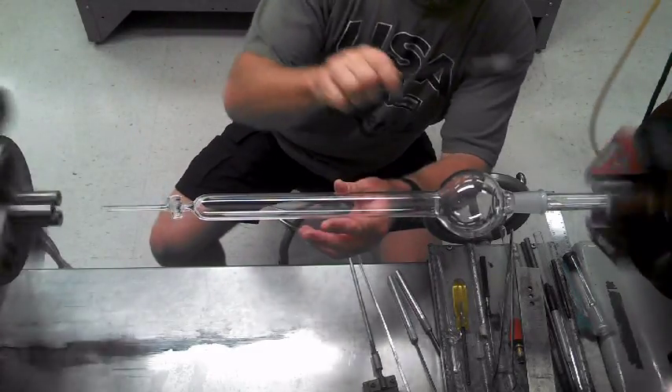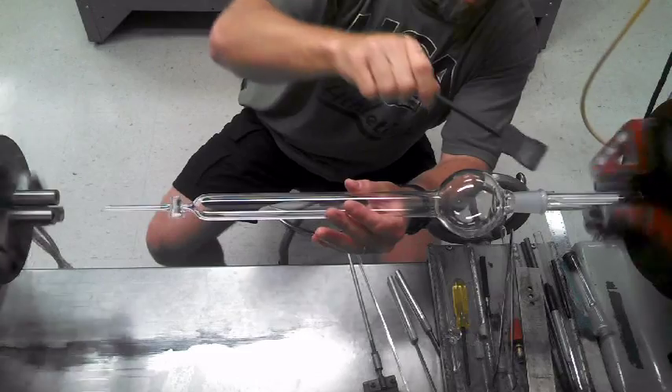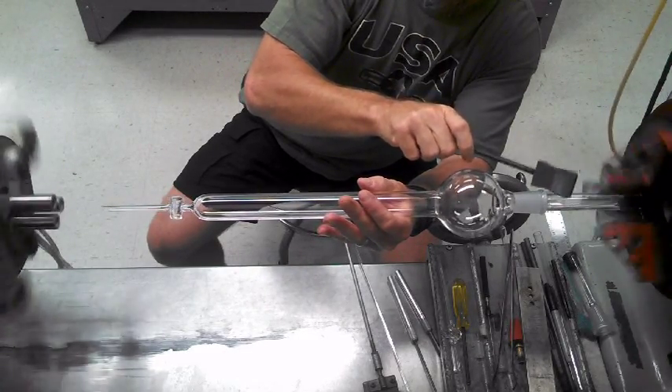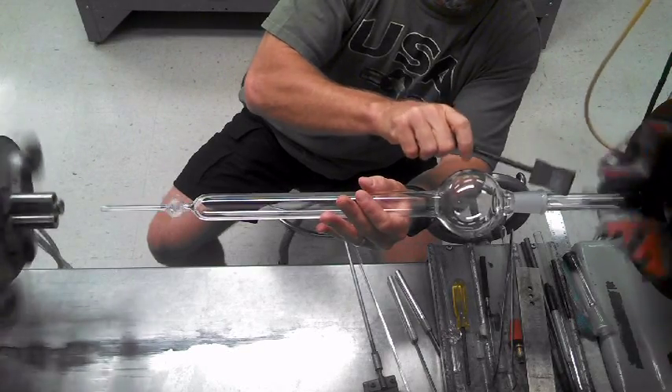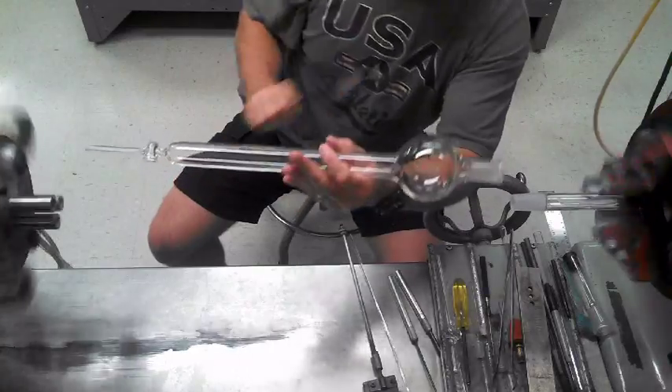When I tap this, I use graphite. This is one I use for this whole purpose — it doesn't crack. It's not too hard to crack it, but it's hard enough to get off. Just listen to the sound. There it goes — hear it? Pull it off.